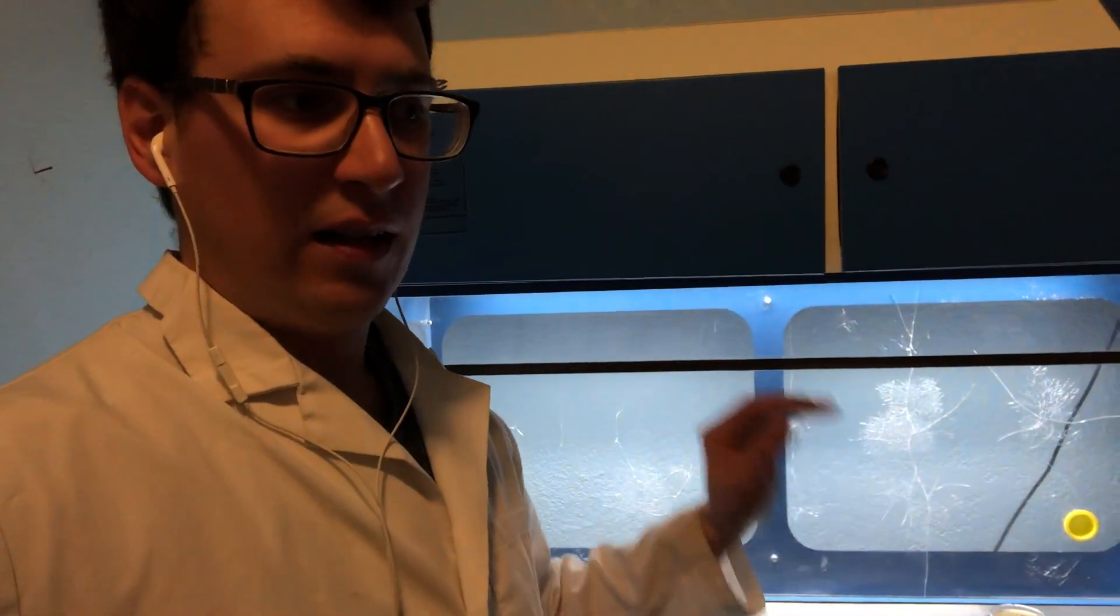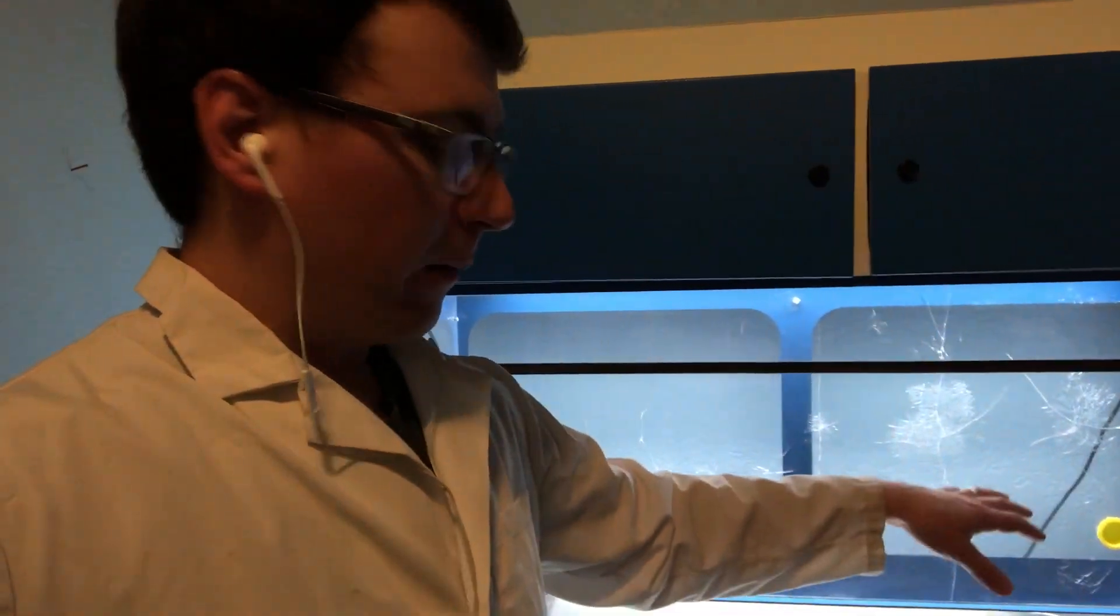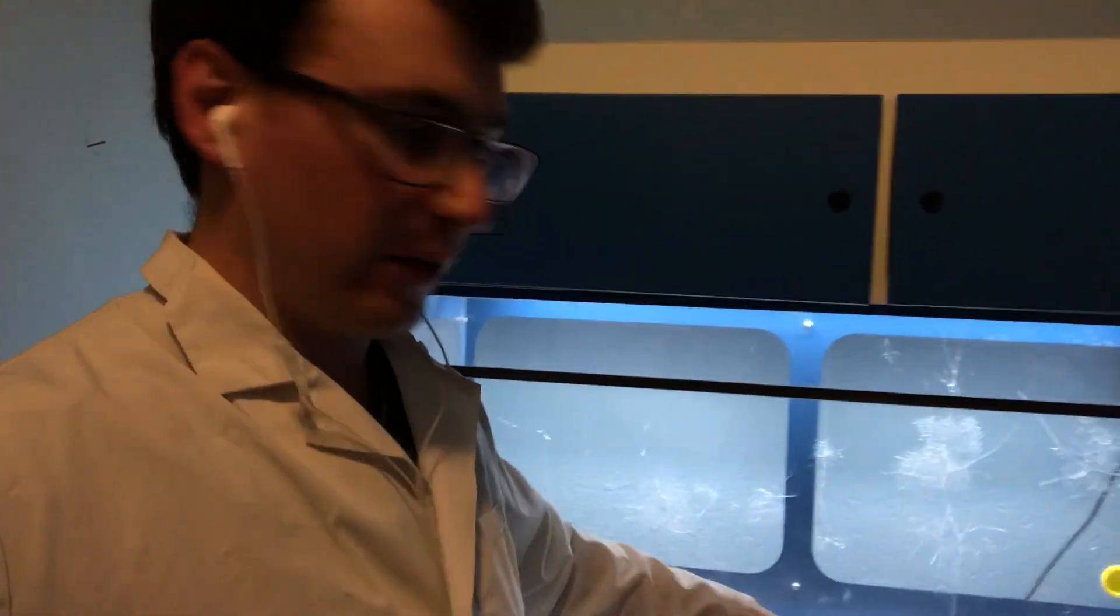So in order to create viable mycelium, we're going to have to systematically introduce these isolates to each other. So that's the next step. Right now these are going in the incubator. I'm going to also isolate the rest of those strains from chestnuts and pioppinos.